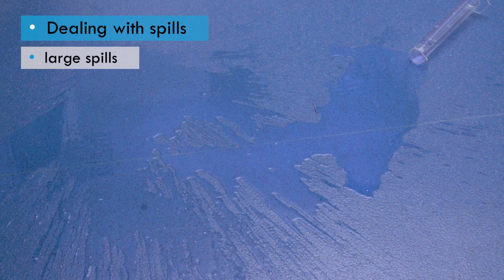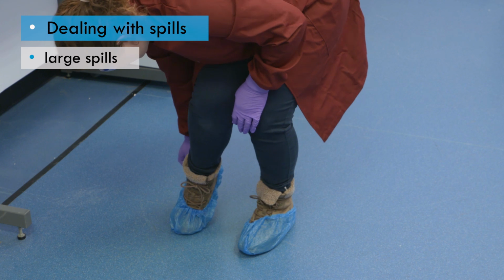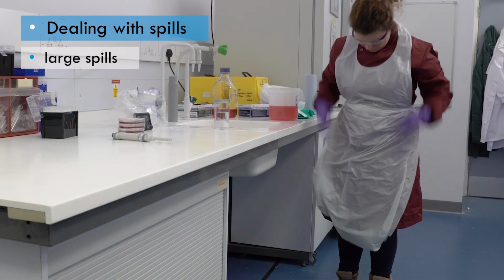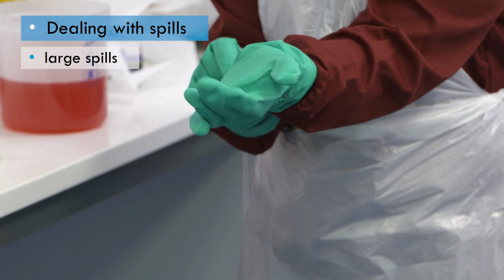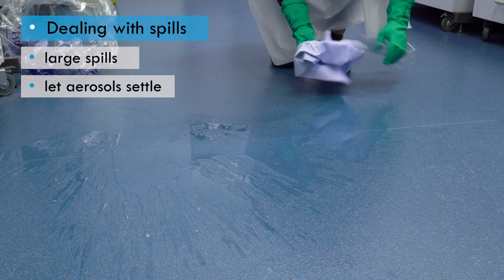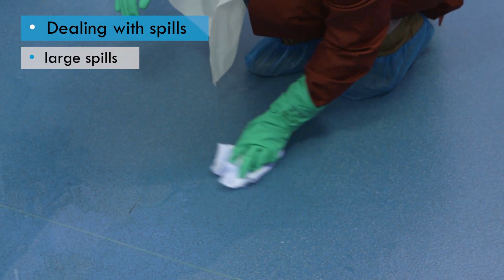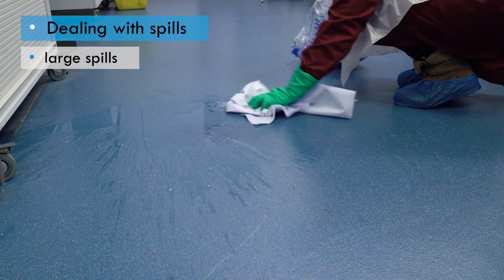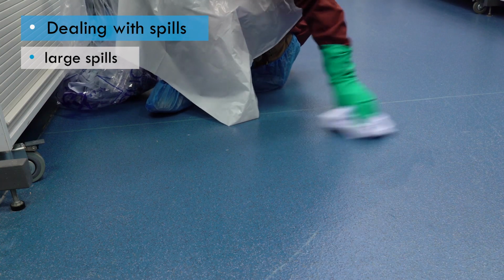When clearing up large spills, there's a greater risk of splashing, so you may need additional splash protection, such as disposable plastic shoe covers or rubber boots, a plastic apron to protect the lab coat, and gloves that will protect against the disinfectant. Where possible, leave the area and allow any potential aerosols to settle out before returning to mop up the spill. Work slowly to reduce any splashing and wipe from the outer edges towards the centre of the spill so that you don't increase the area of contamination.